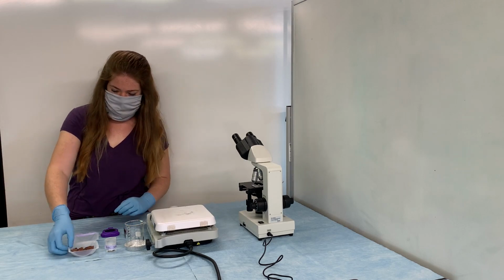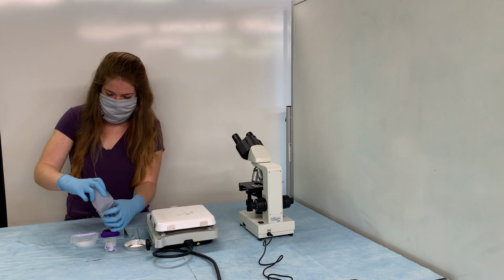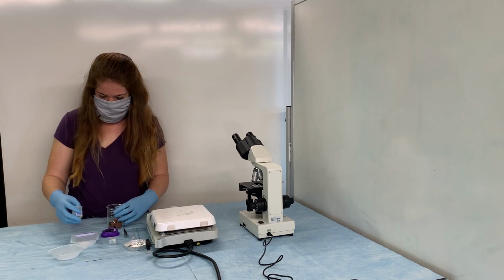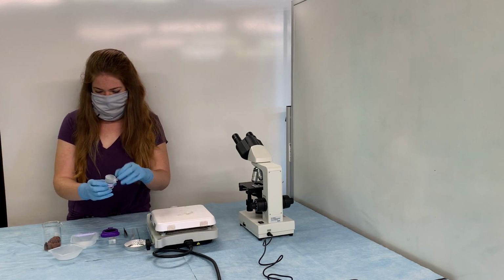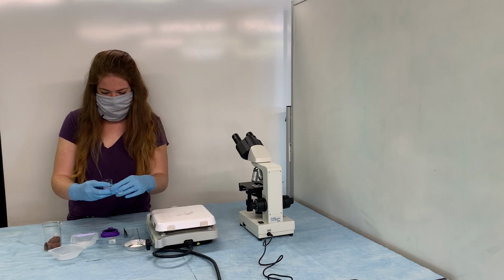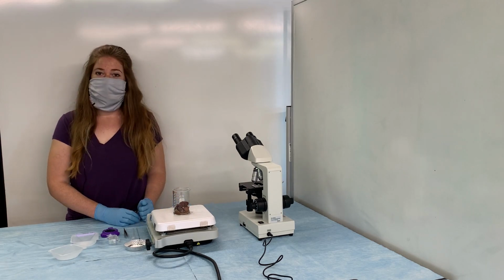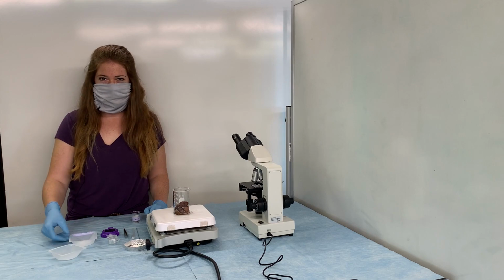Alright, again, so I'm going to take the lava rocks, add them to our beaker here, and then our acidic saline solution as well. And this is 10 milliliters, already measured out. And so now we just need to wait until this reaches a boil, and we'll be adding our amino acid mixture.